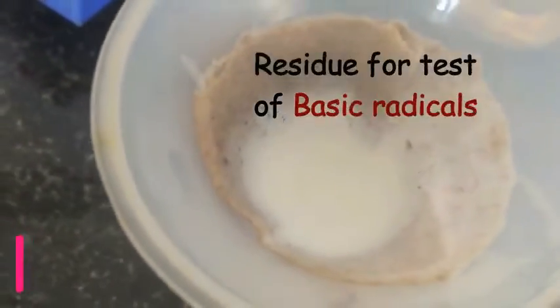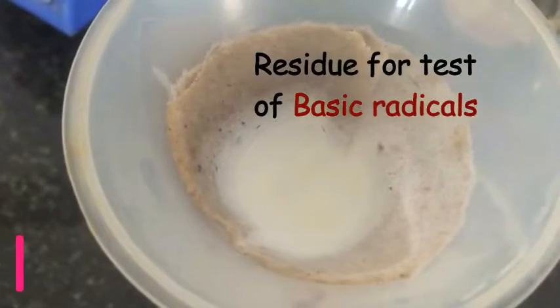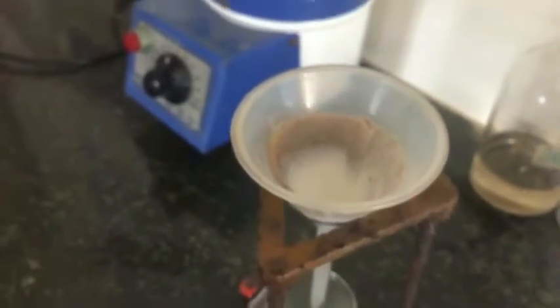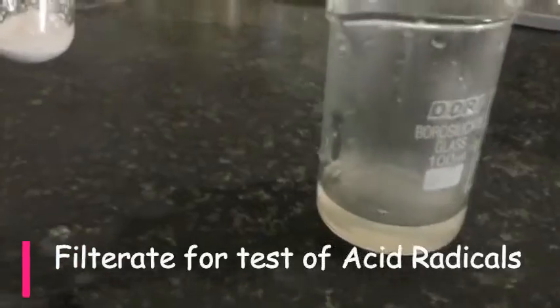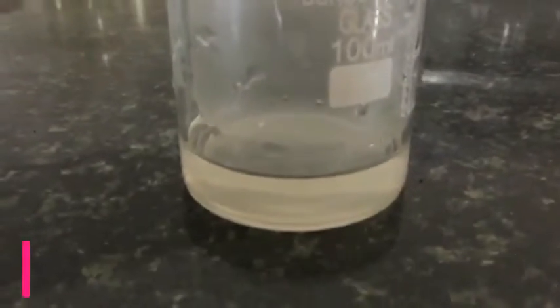Here we have the residue, and this residue can be used for the test of basic radicals. Here we have the filtrate, and this filtrate is used for the test of acidic radicals.